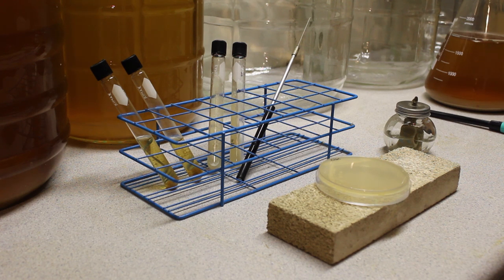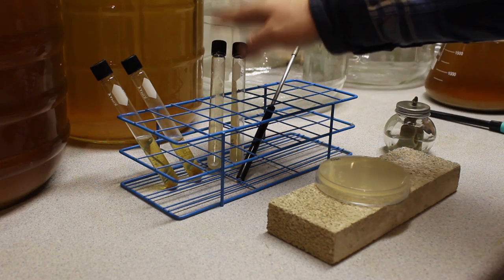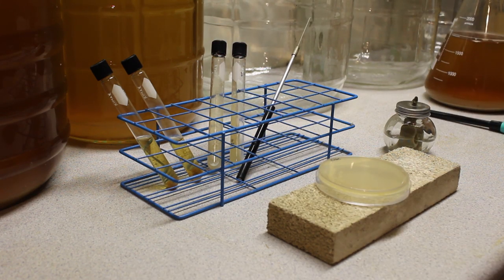Brian from Sui Generis Brewing here, and today I'm going to show you how to take yeast from a plate or from a slant and use it to make a yeast starter.